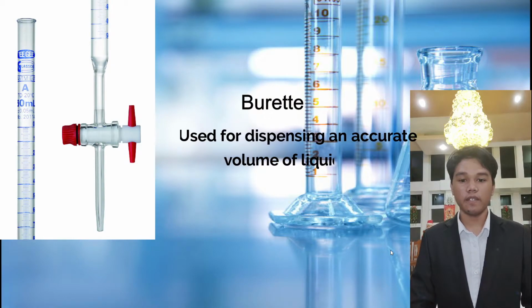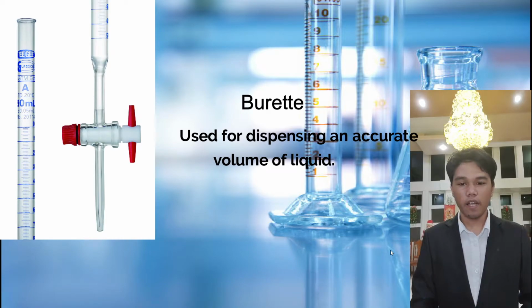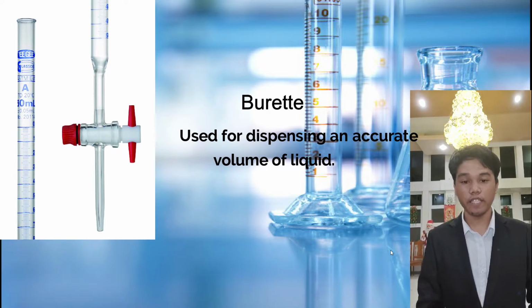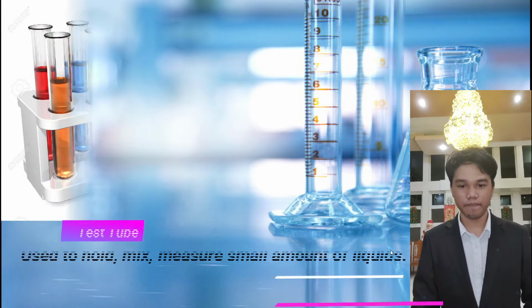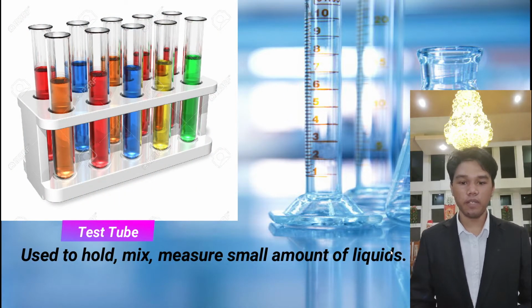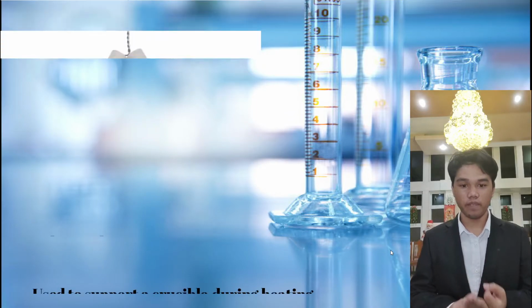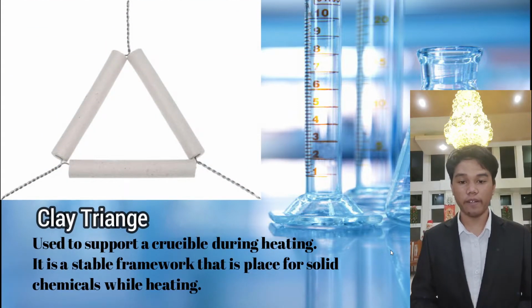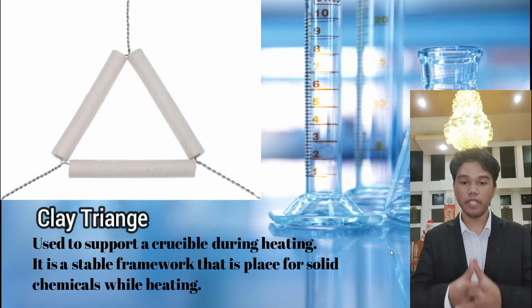Next is burette. It is used for dispensing an accurate volume of liquid, and it is used for titration in a volumetric analysis. Next is test tube. Test tube is used to hold, mix, and measure small amounts of liquid. Next is a clay triangle. It is used to support a crucible during heating.